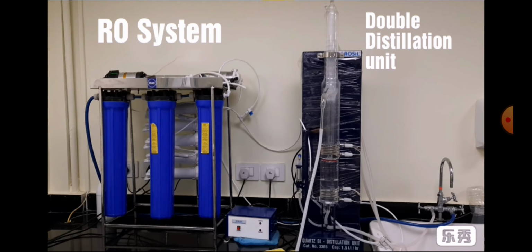Then the RO water will come to the first boiler of the distillation unit, and the water will be heated or boiled in this first chamber. Then the vapor produced in the first boiler will come through this channel and condense here, and come to the second boiler and be collected in the second boiler.